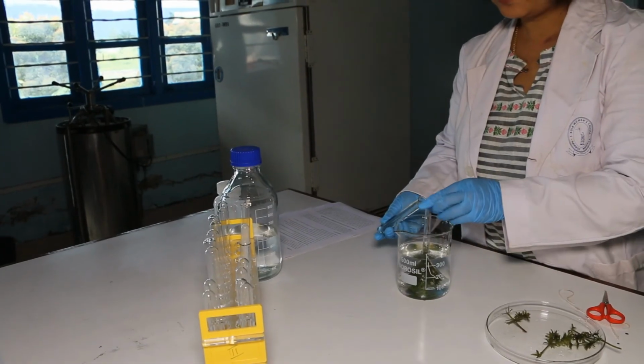Wavelengths of light outside of the red and blue ranges are not used by most plants and can contribute to heat buildup in plant tissues. This heat can damage plants and even interfere with photosynthesis. So in this study, we're using an LED plant bulb which produces a strong output in both the blue and red wavelengths, with very little additional light in other regions to cause heat buildup and thus promote photosynthesis optimally.